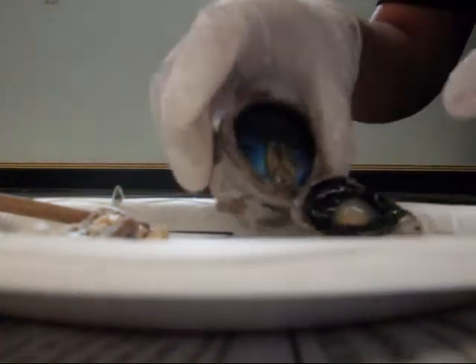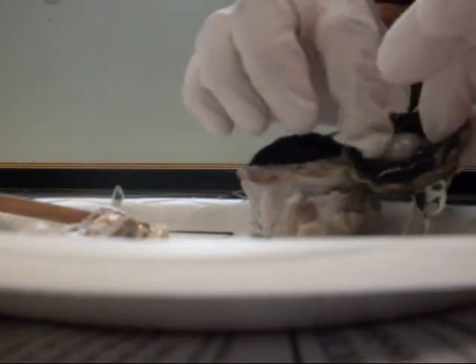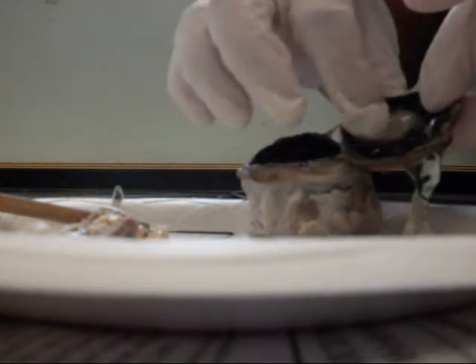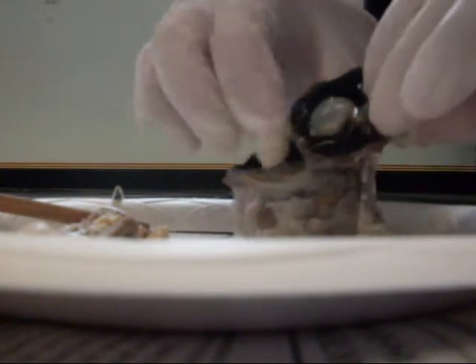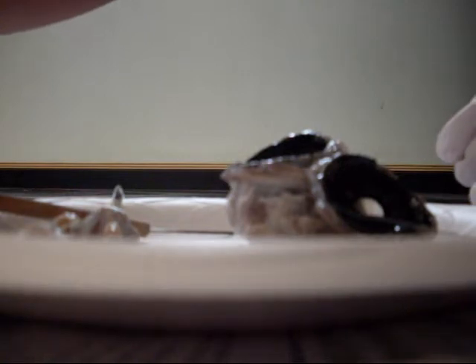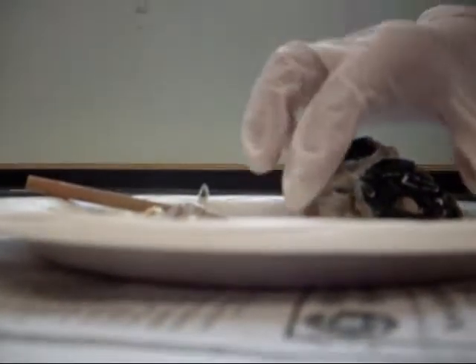Show it to the camera. It's watching, dude. Show that — ew, is that the — oh, I thought that was the eyeball. Yeah, the eyeball is extremely tiny. I know. Ew. I did it, oh my God, it's extremely hard. The cornea. Are you serious? It's hard? Yeah. This is covering your pupil, it's just the opening. I would tell you to touch it, but you can't. That's sick, dude. Show it to the camera. This is like what magnifies it.